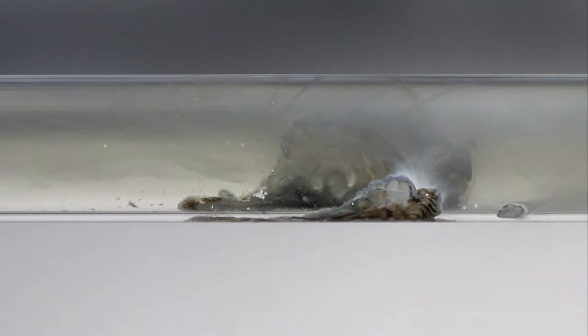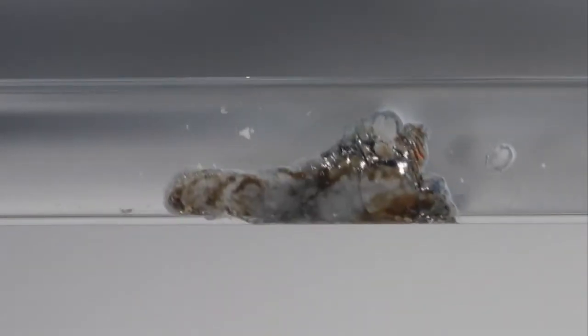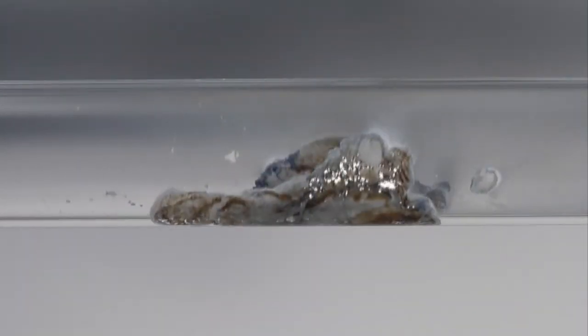If water is added to the tube, the metal reacts violently and the deposit completely dissolves, leaving a clean glass surface.